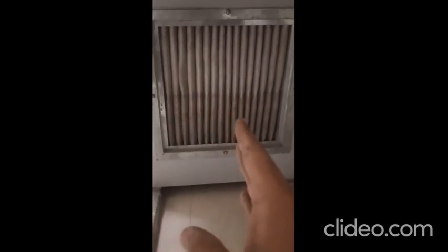You can see the UV light here, and there is the pressure barometer you can see, and here is the blower, where air goes in from there. That blows air, and the HEPA filter is also there, which is used for the efficient working of different types of testing and microbiological aseptic area.